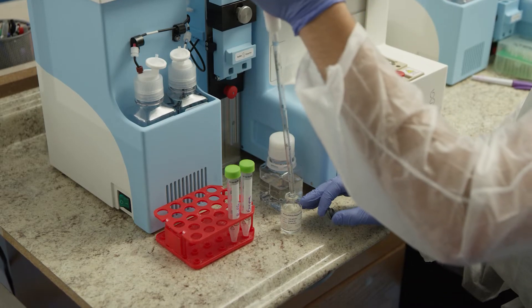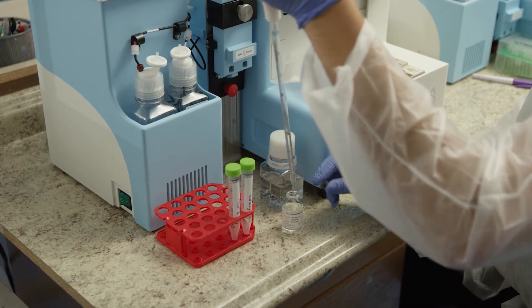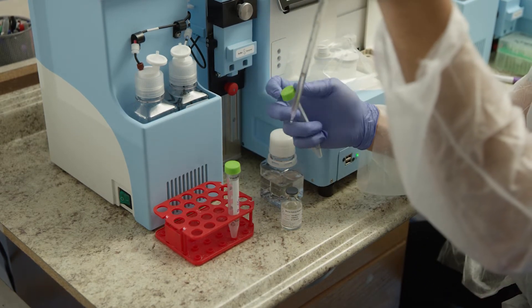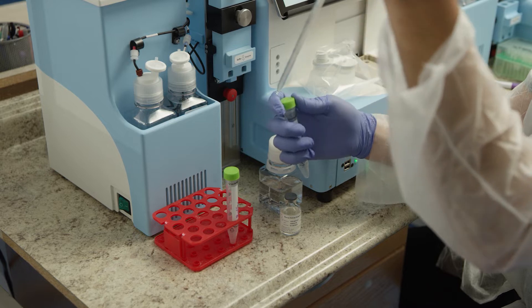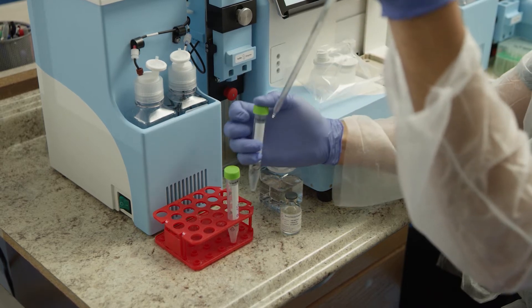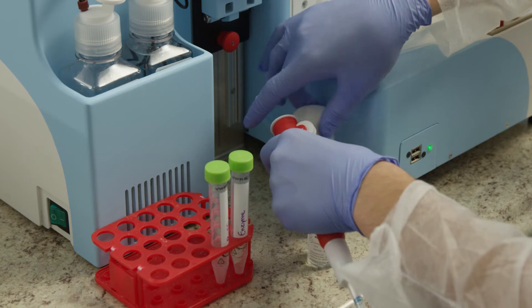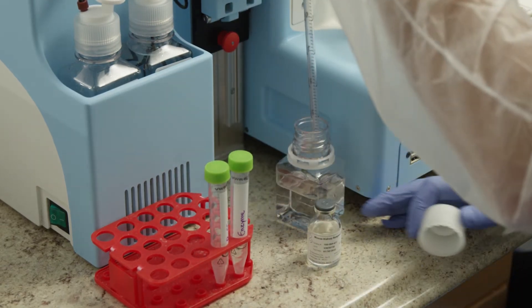Load 3 mL of enzyme cocktail into a 15 mL conical tube. Add 6 mL of buffer in a second conical tube.